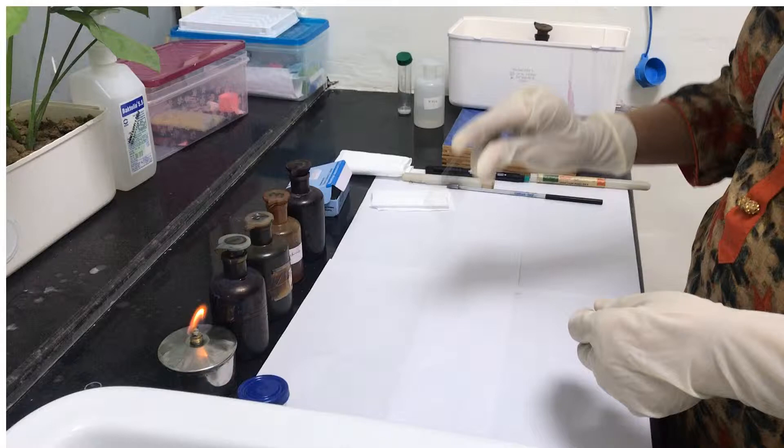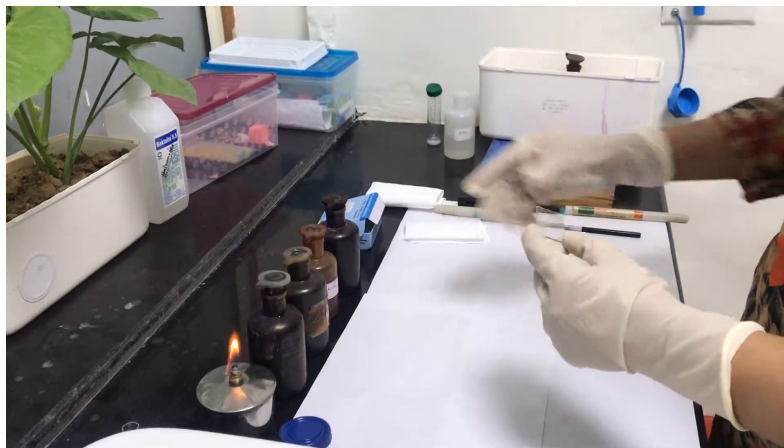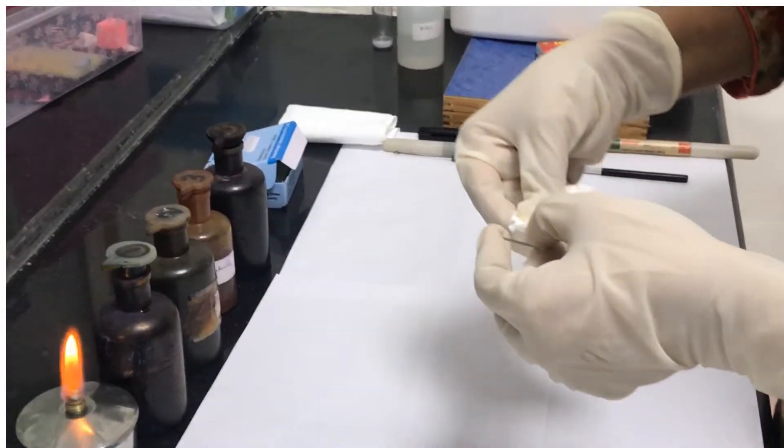Stain, soap, grease or oil-free slides are essential for preparation of microbial smears.